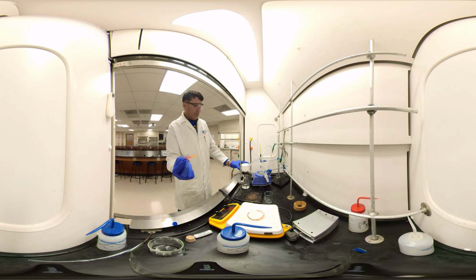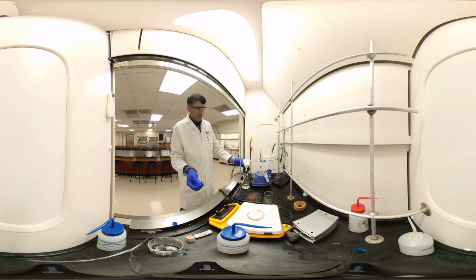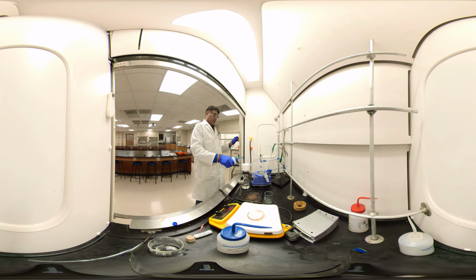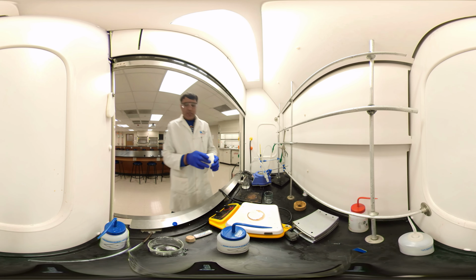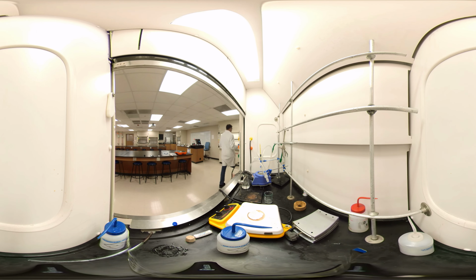I have the other end. I'm going to test it. Let's see. It's still acidic. So once more. I believe it's free from the acid, so I'm not going to test anymore. We washed a lot. This is the benzoic acid. We need to recrystallize. Let me get the paper thing.